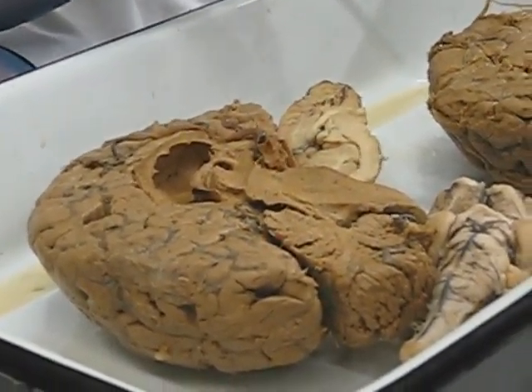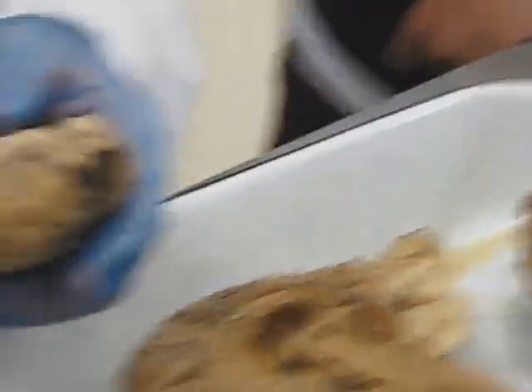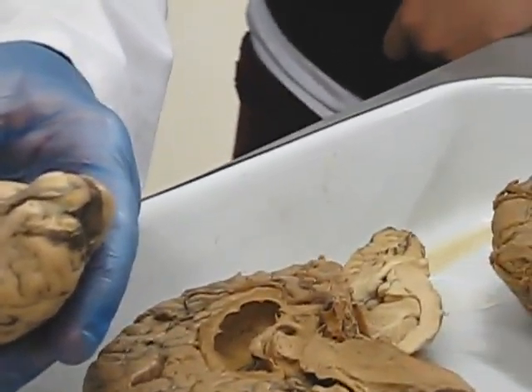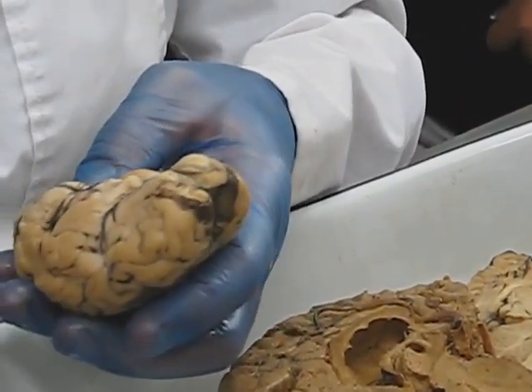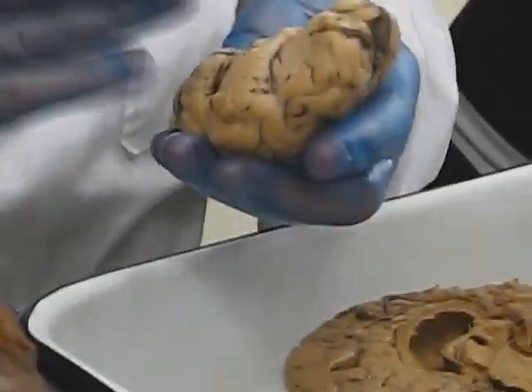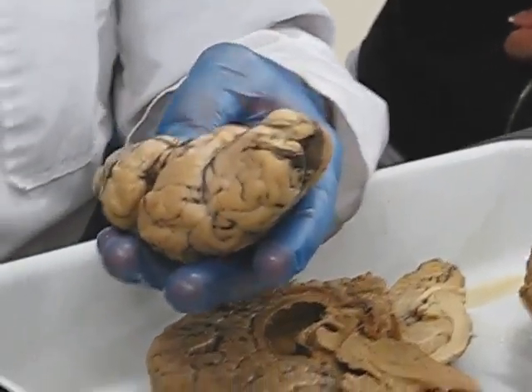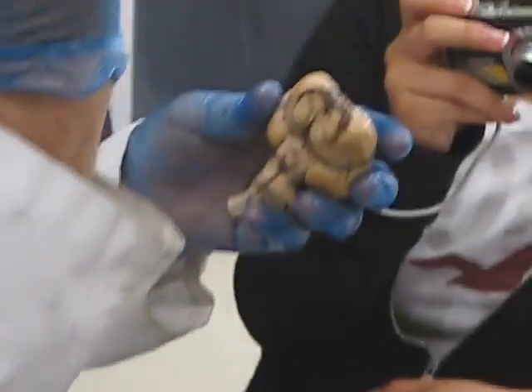So the cerebral peduncles, let me show you on this. Here's a cerebral peduncle right there and right there, part of the midbrain. I don't want to tear this open to show them to you here. I want to leave it be. The ancients thought that this part of the brain stem looked like little feet holding up the cerebrum. Peduncle means little foot. So they're little feet holding up, and it's upside down, of course, so they'd be holding up the cerebrum from below.